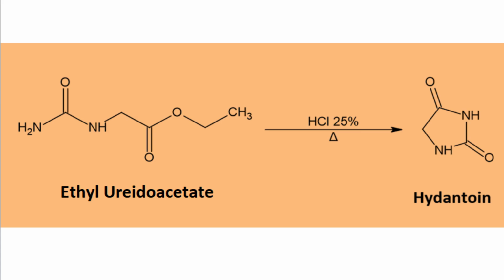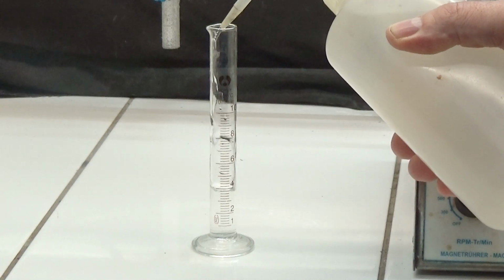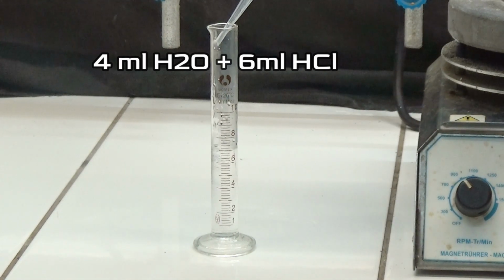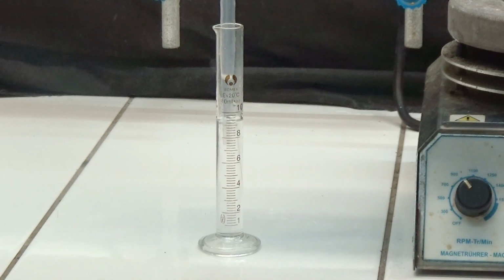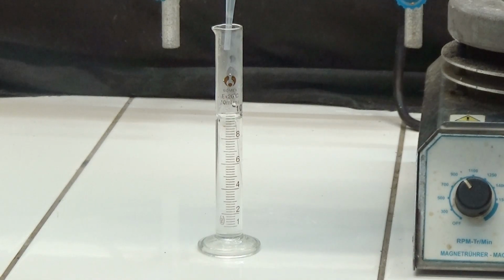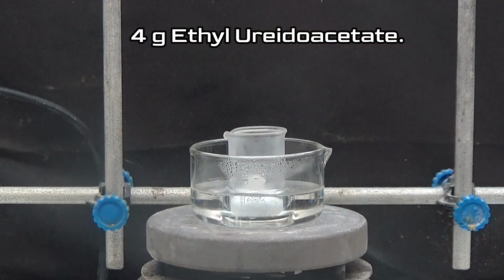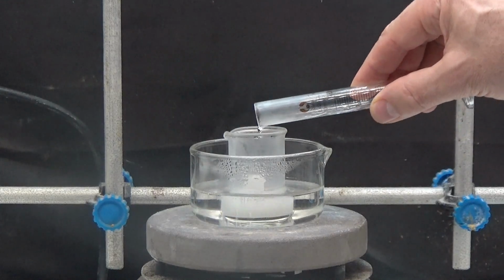Now we are going to obtain the Hydantoin. First we prepared diluted hydrochloric acid. We put in a test tube 4 milliliters of water and 6 milliliters of concentrated hydrochloric acid. We put in a bath of hot water, a glass of 25 milliliters with 4 grams of ethyl uridoacetate. We add the diluted hydrochloric acid that we have prepared.